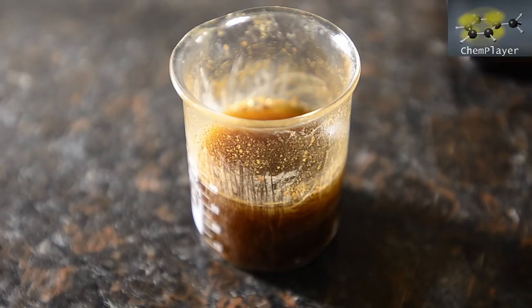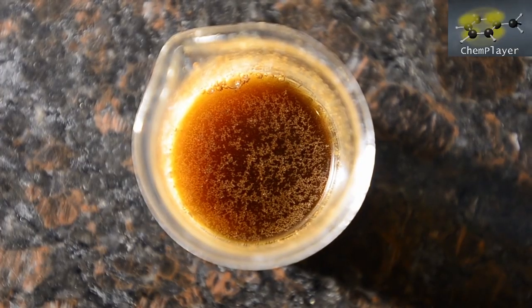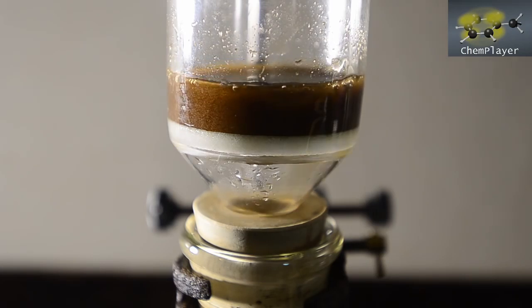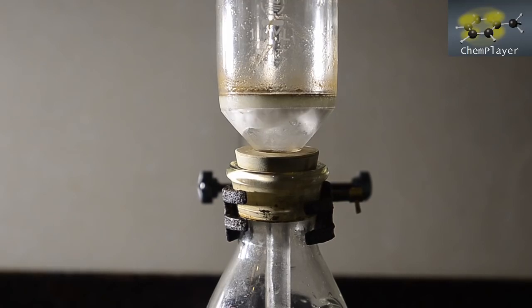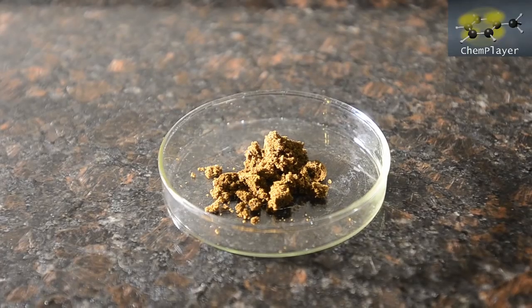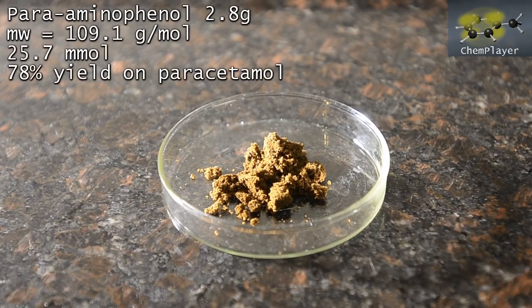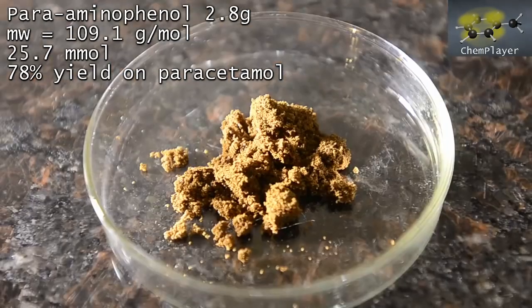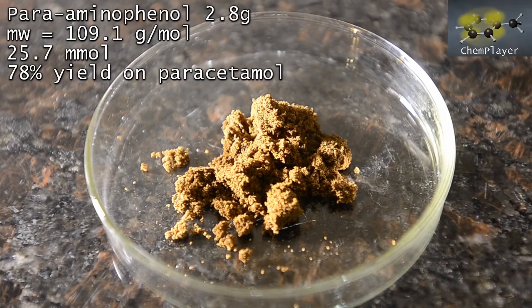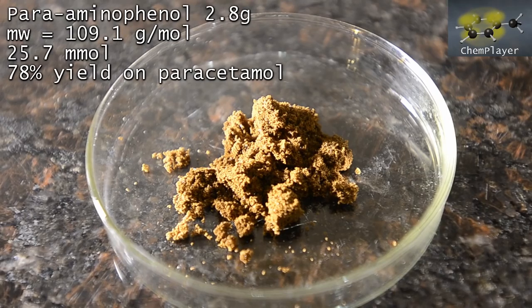And here we go, a few hours later. Lots of yellow-brown crystals. So let's filter and see what we get. And our recrystallized product, 2.8 grams of aminophenol as dry tiny crystals. But it's still brown. This substance is a bit like anthranilic acid. Trying to purify by recrystallization is quite difficult and results in dark decomposition products forming.